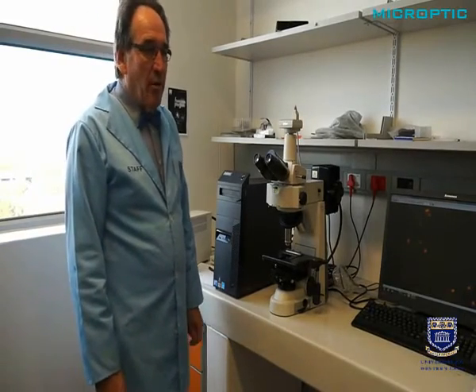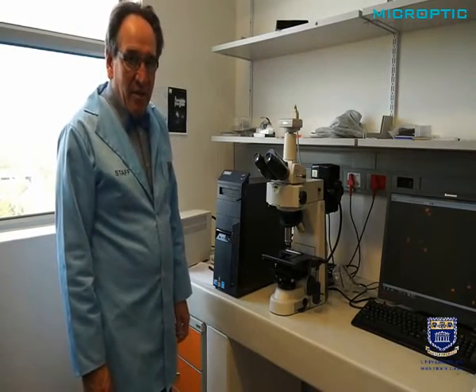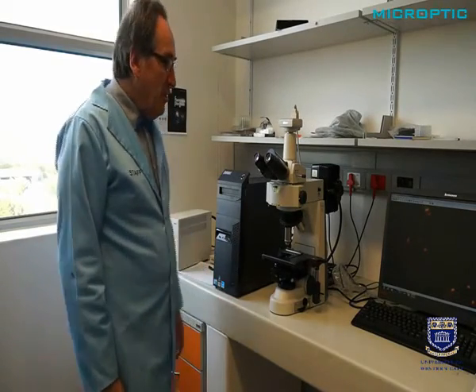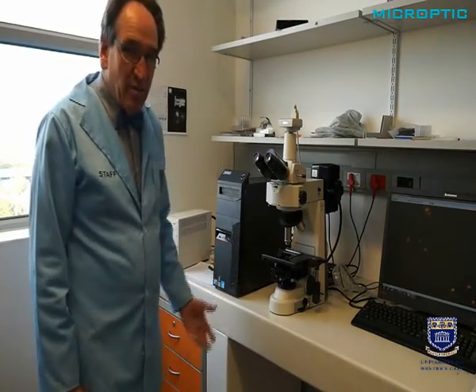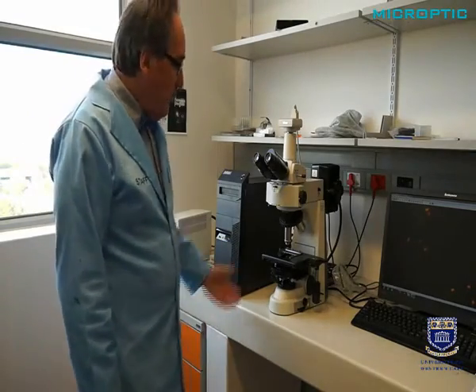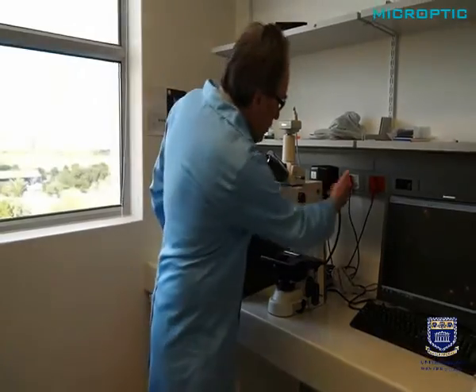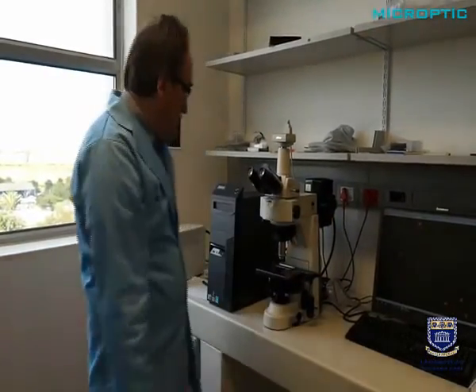It is not the intention of this to show you all the modules of the sperm class analyzer and CASA analysis, but rather to show you the typical setup in a lab. And here you can see if you want to do fluorescence, for example vitality staining, you need again a good microscope, but then with of course epifluorescence attachment.